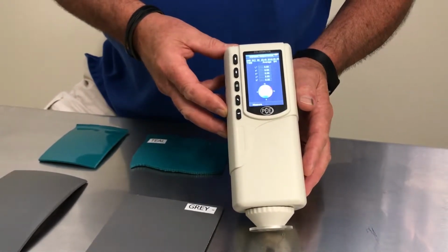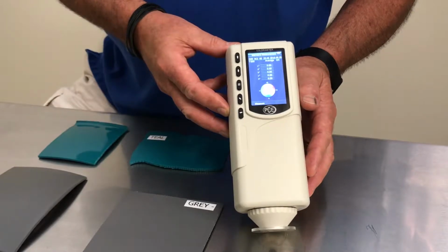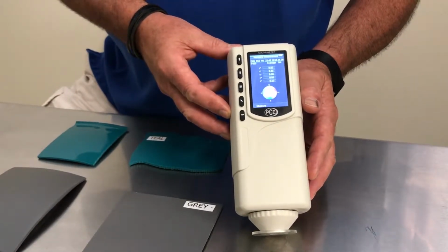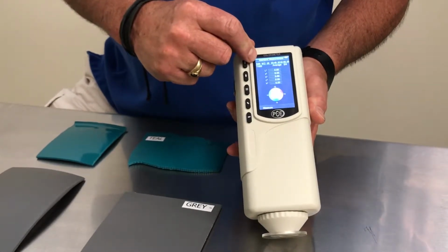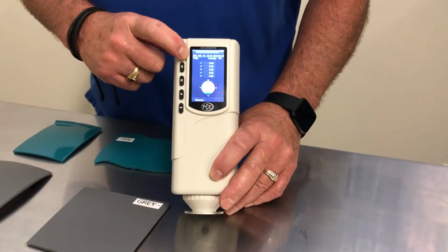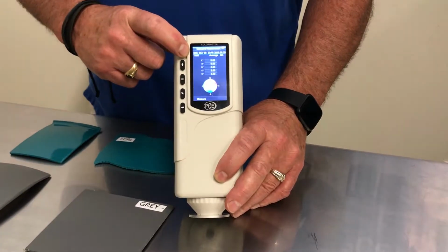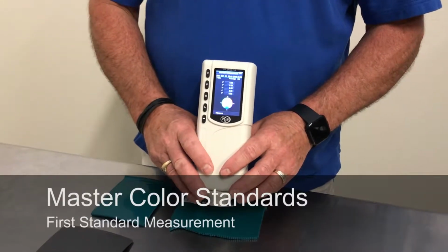The internal memory of the color meter PCE-CSM 1 through 8 allows for 100 standard measurement values to be saved. Each of these is categorized by a number. We will enter 3 standards into the memory of the meter before we compare them against the samples. So let's get started with the setup for the standard measurement.